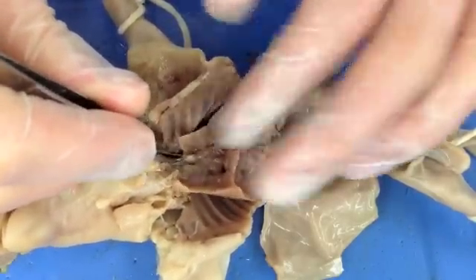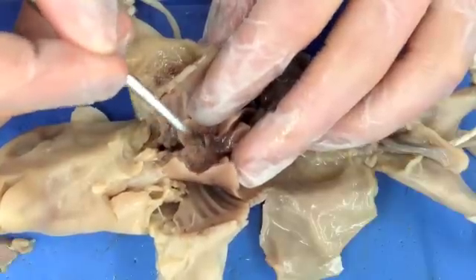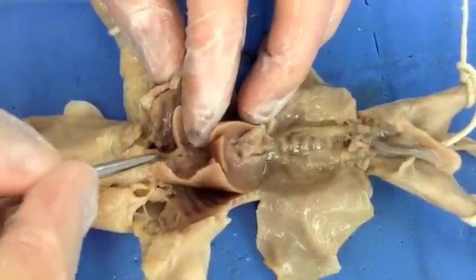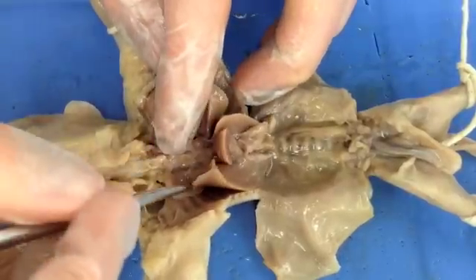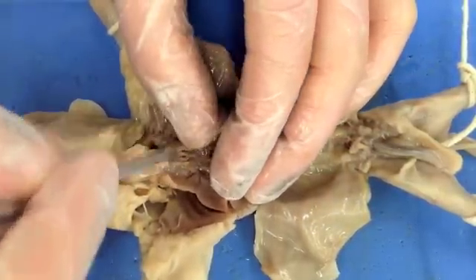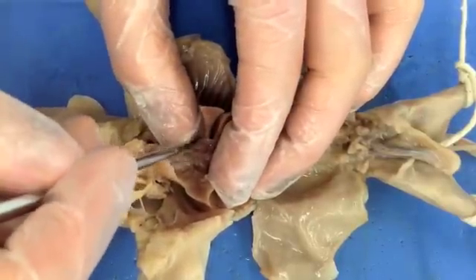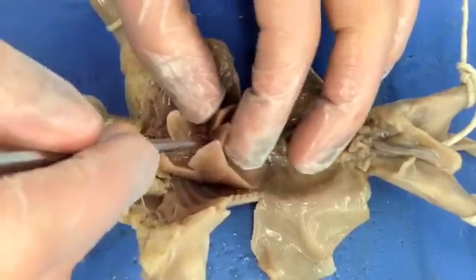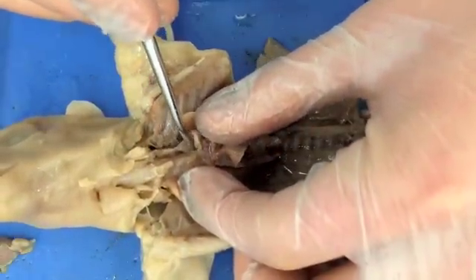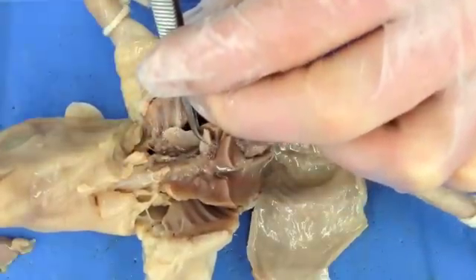I'm just trying to gently tease away this connective tissue here. That's the remnants of the aortic arch — that's part of the aortic arch.